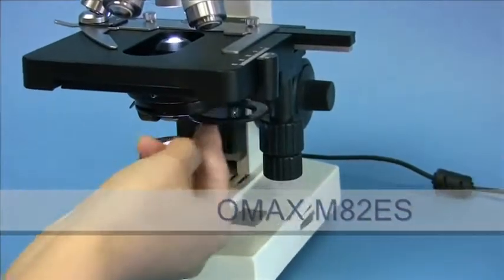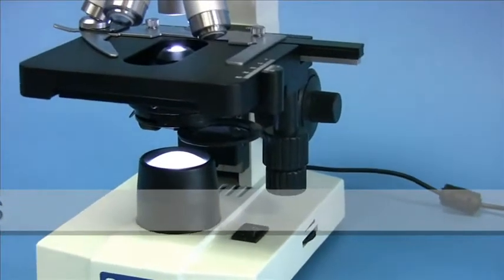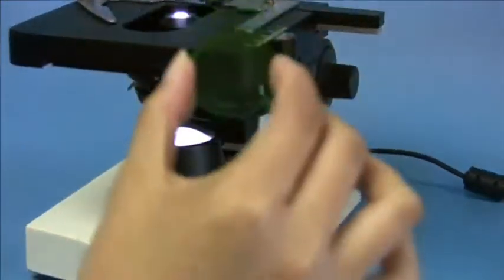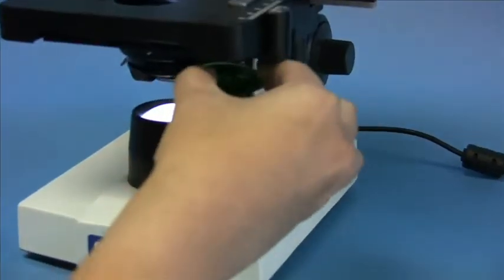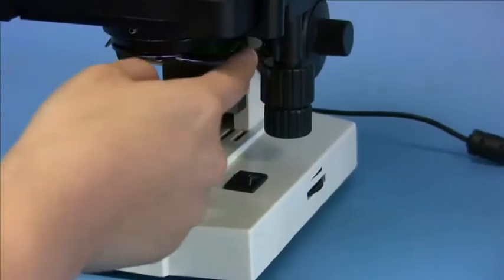Also, there is also a filter holder. So here, I'll use the green filter, and simply put the filter in the holder, and slide it back.